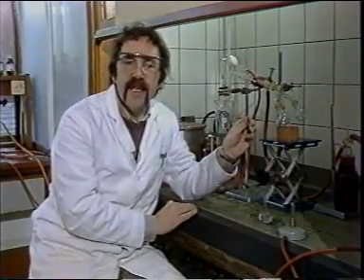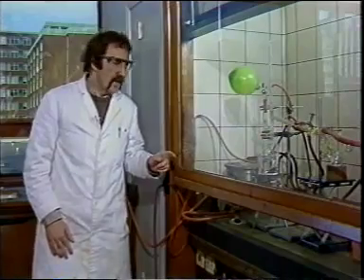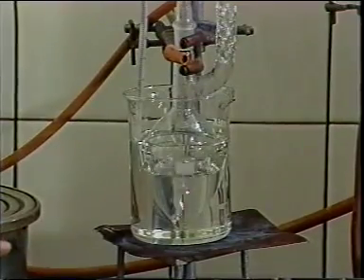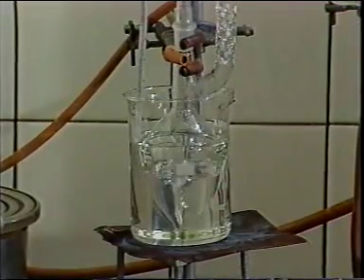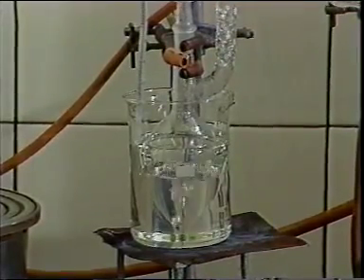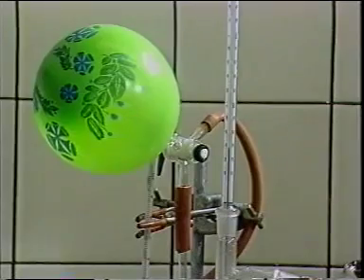Let's now look at a real vacuum distillation apparatus in operation. We've set up our vacuum distillation apparatus here in the fume cupboard. Note the safety screen between ourselves and the apparatus. We're using an oil bath here to heat our liquid with a temperature some 10 to 20 degrees above the expected boiling temperature of the liquid in the flask. Note the stream of bubbles through the bleed, which is constantly agitating the surface of the liquid, giving us even boiling. In this setup, we've used nitrogen from a balloon to pass through our air bleed to prevent any oxidation of the hot liquid as it distills over.